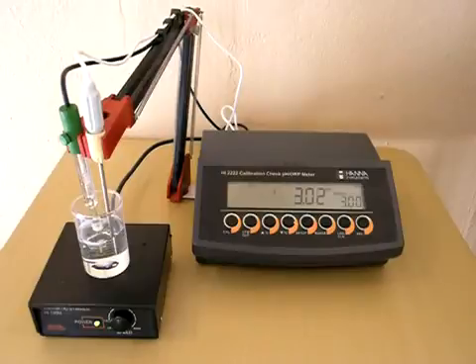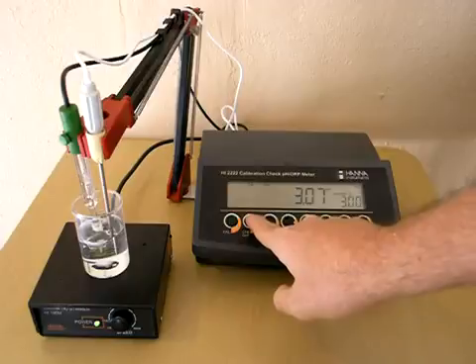The screen's already counting down. We'll wait for it to cue to confirm. You'll notice your buffer isn't exactly 3.0. It's because we haven't hit the cal button yet. Once we do that, it will bring it in line with the temperature compensation. We confirm.